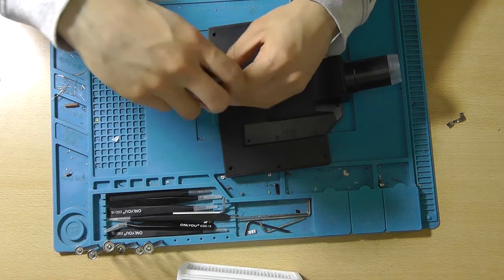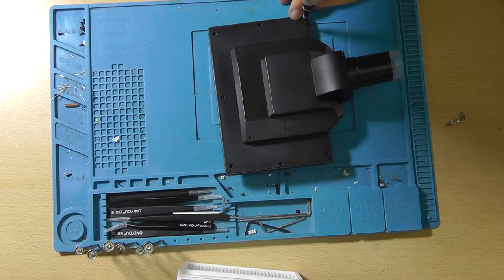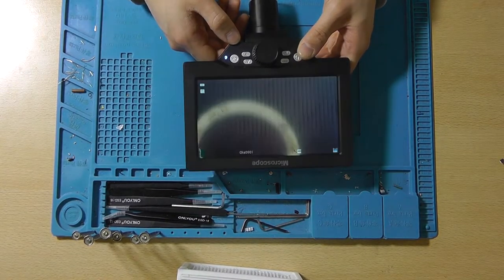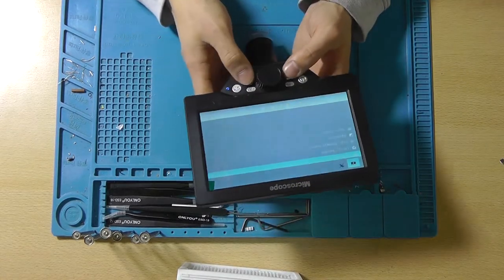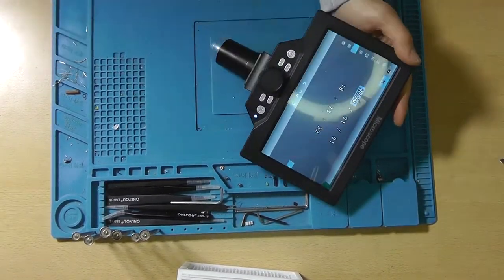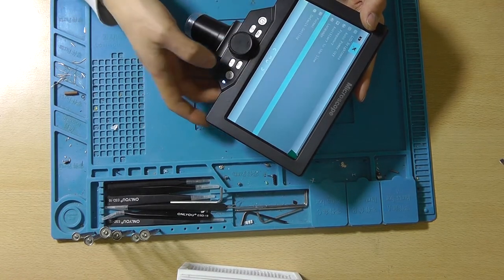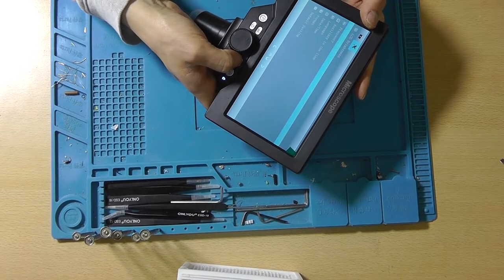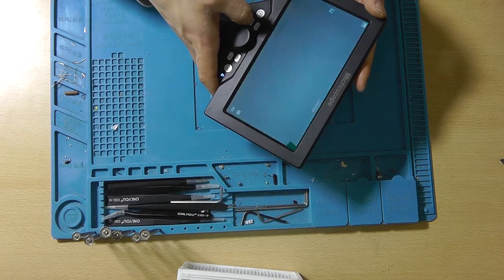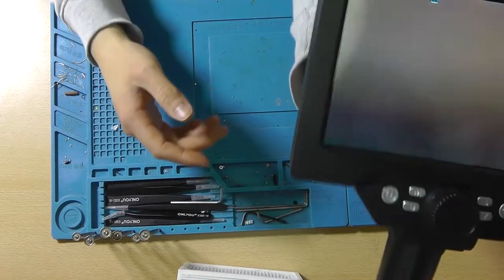And let's see if the time and the date is now saved after an unplug and a reboot, which hopefully it will. It's back in one piece. Let's turn it on because it should still work. There you go. Let's go into the menu and let's actually set the date and the time. There we go. Actually, I do indeed want a date stamp. So there's the date at the bottom.